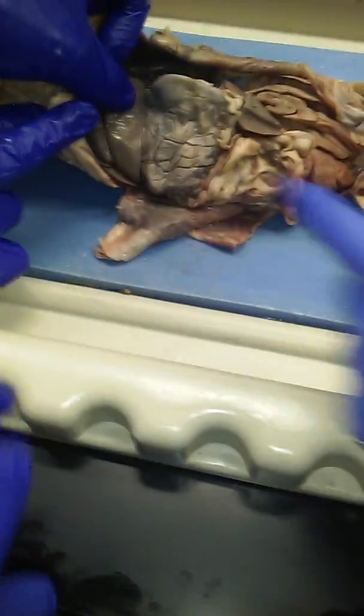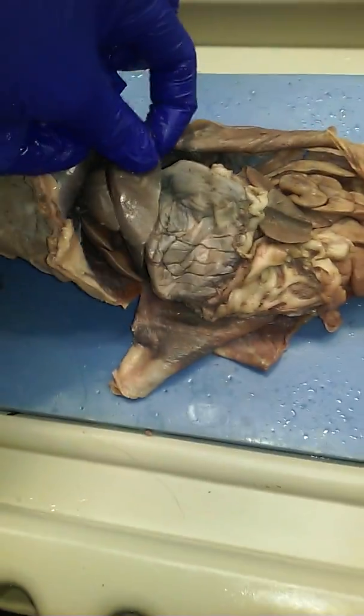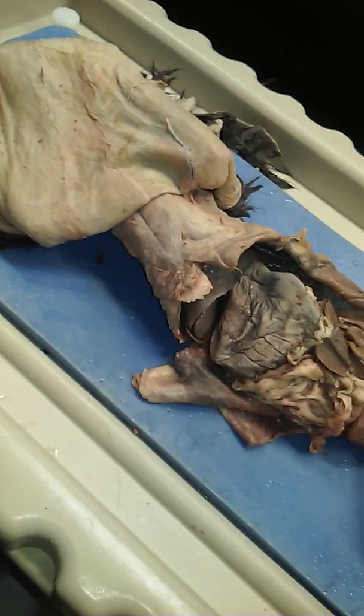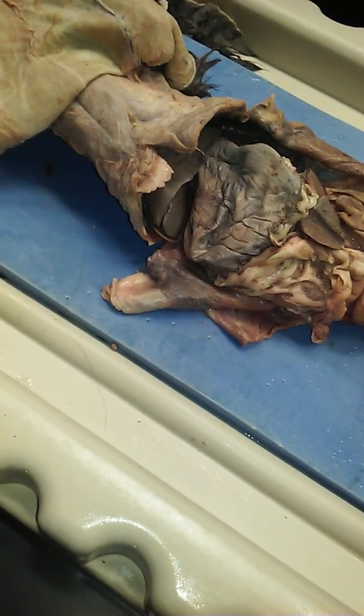It's solid, right? When you pinch it, you can feel the dense liver. It's a cellular structure. A liver is dense cells and capillaries. Now, one of the things that should be apparent to you is that it's divided into chunks.